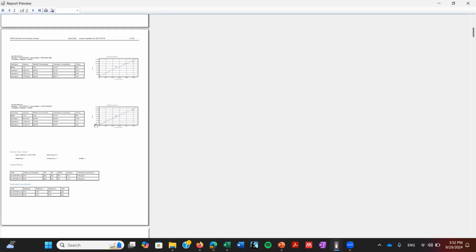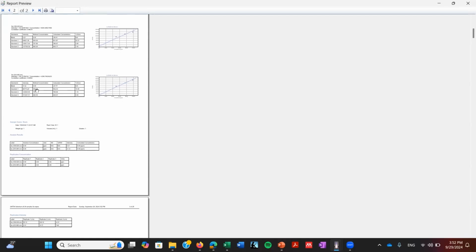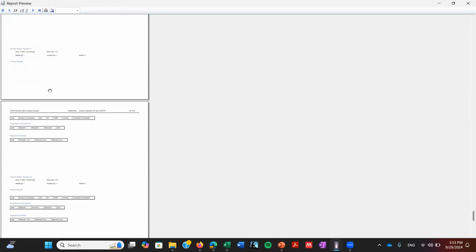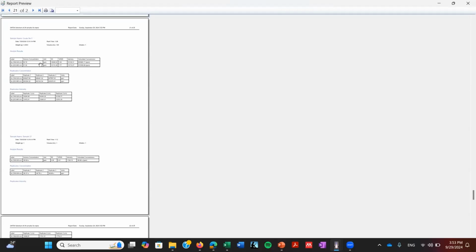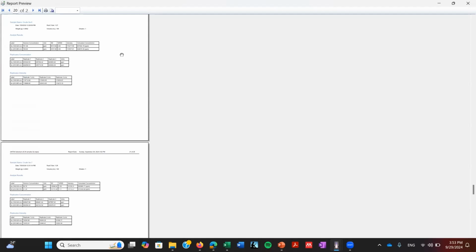This is the report that we're generating. And as you can see, it's a very comprehensive report, because you can see the calibrations, the standards that you're using, the intensity of each standard. And then, of course, eventually, you're going to be able to see the results that you got. Here you go. Analyze results. So this is another method to do the same thing. It might be very useful if you have a lot of data, but if you have very few values, it's probably better to validate one by one. That way you only export the data that you know for sure is correct.